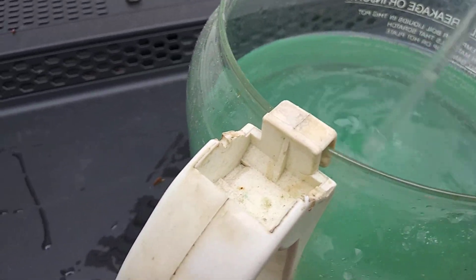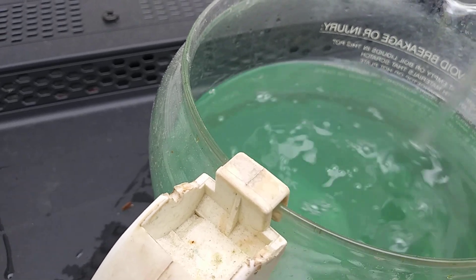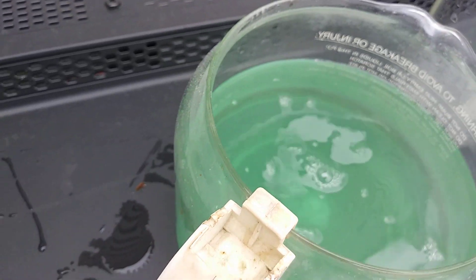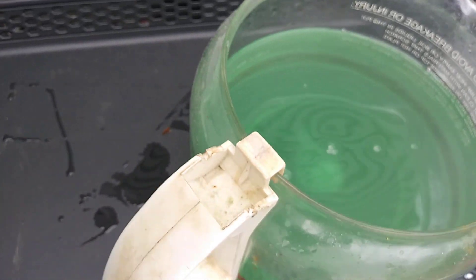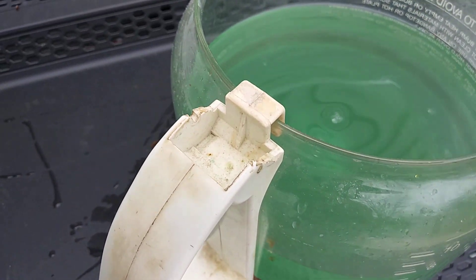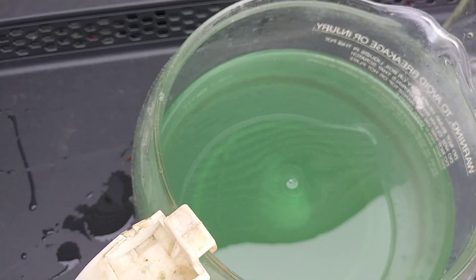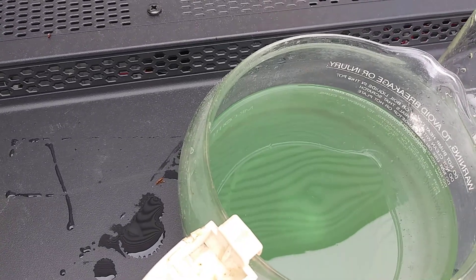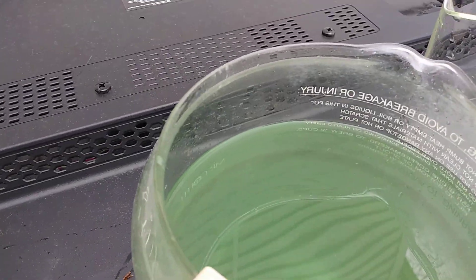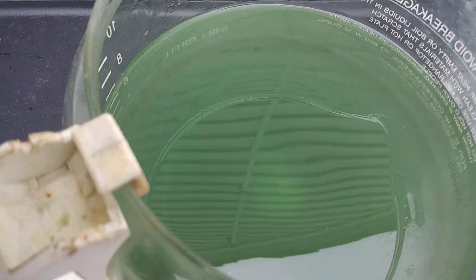So I don't really know how old this sodium metabisulfite is. I took my respirator off and it's still a little strong. Trying to stand downwind from it. But it is turning. As you can see, it's getting darker.